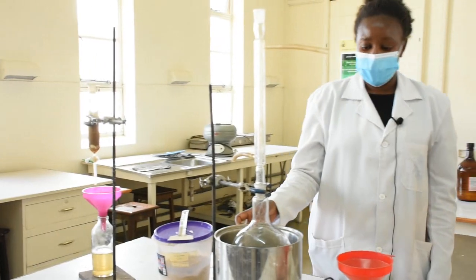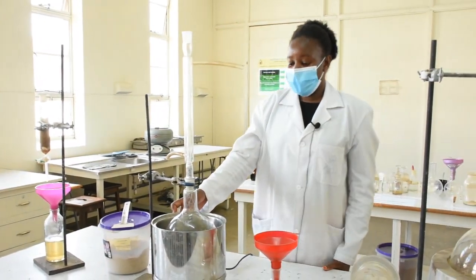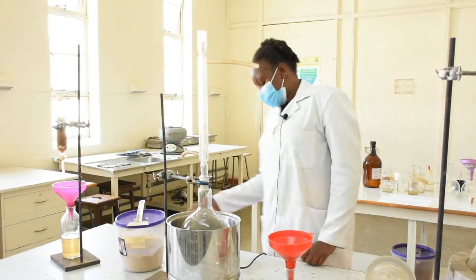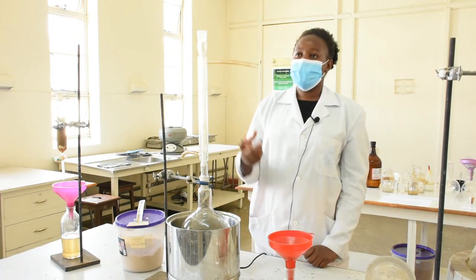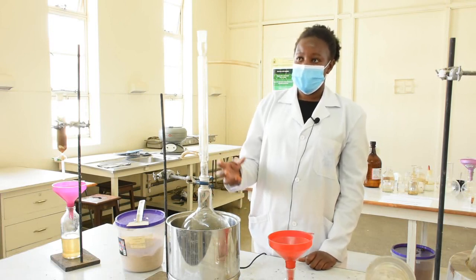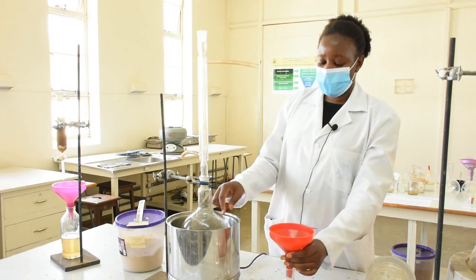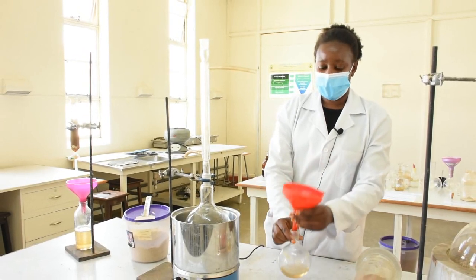Another extraction method is refluxing. Here we pack the material in the extracting flask, add our solvent, then heat it and let it run for several hours to extract the plant material. Once we have exhausted the extraction, we filter the solvent to be left with our extract.